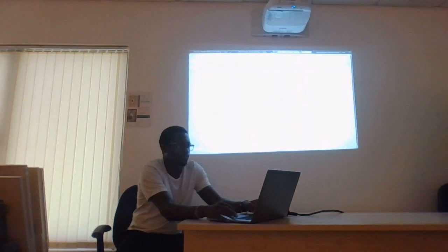So the first one was params.reads. I don't know if I should do this or it will take much time, but as you say rightly, we can easily say that we want this to be in our project directory and then give it a name. So if it's not existing, Nextflow will create it. Okay.